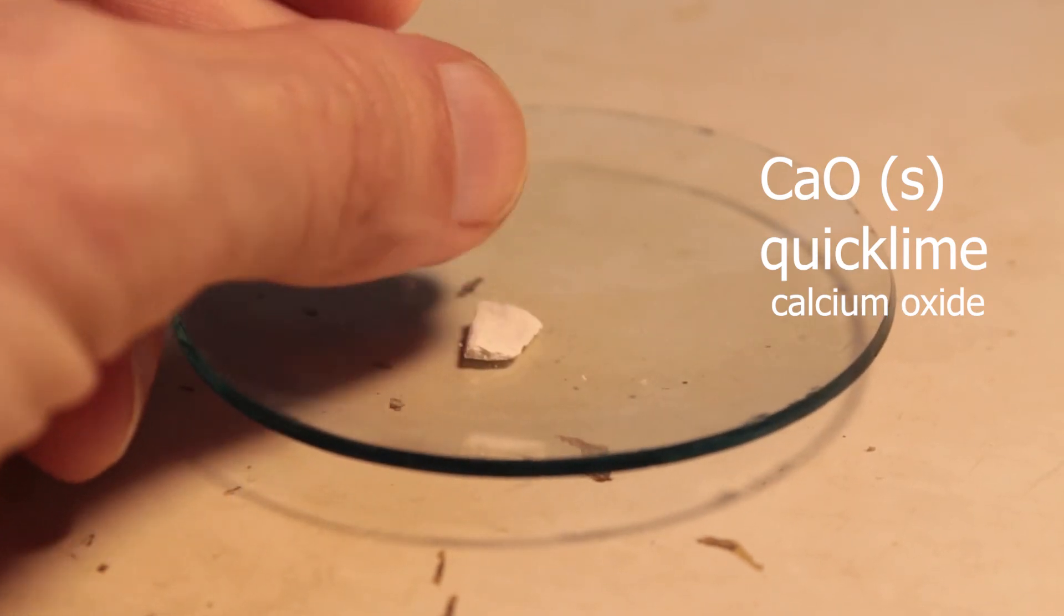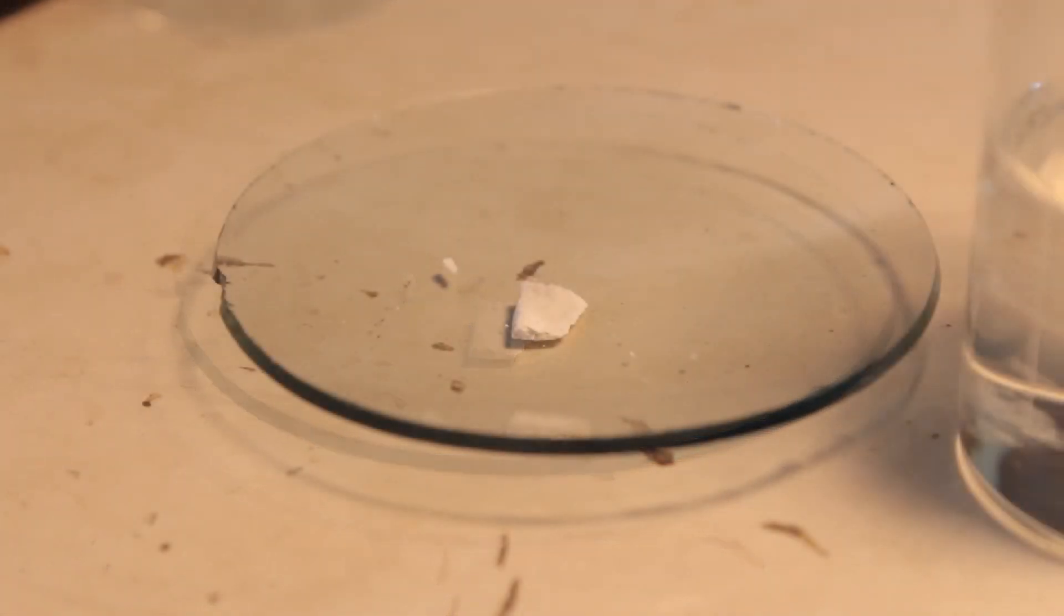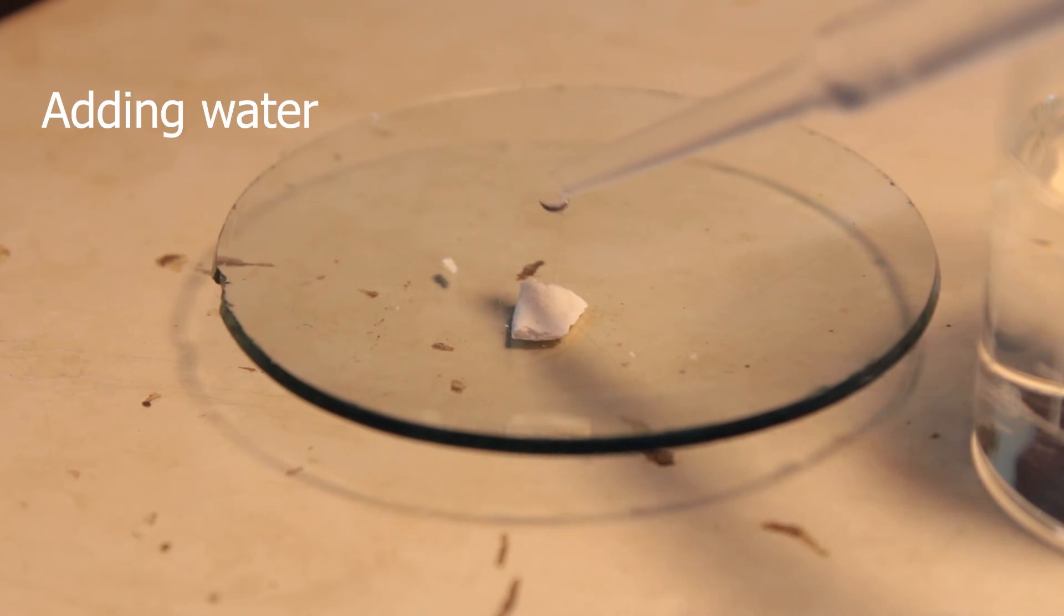And now, I'm adding few drops of water. You see what happens? It hisses and expands. The temperature obviously grows, the water boils as it's added, and chemical reaction is taking place.